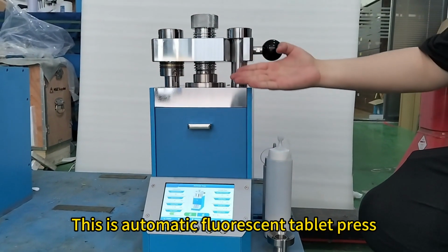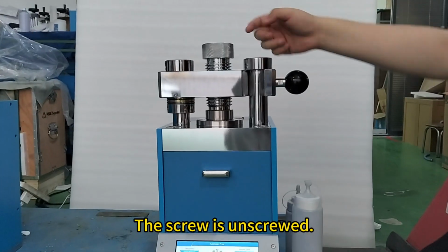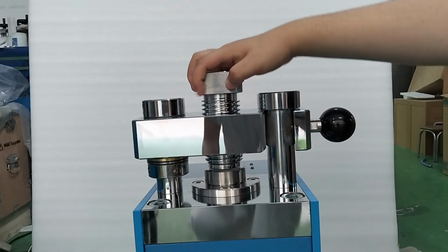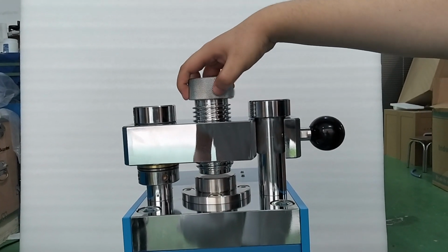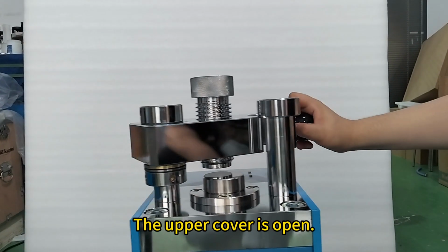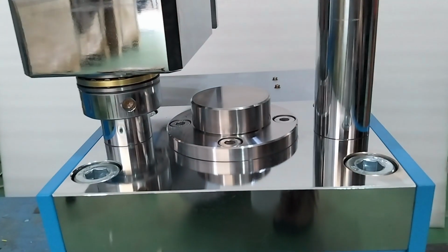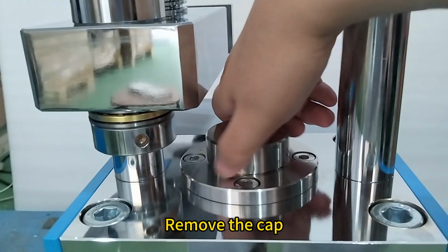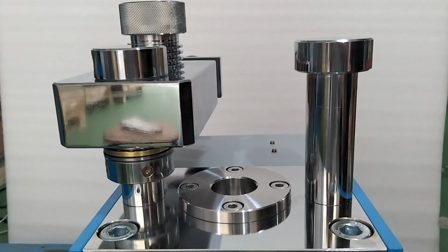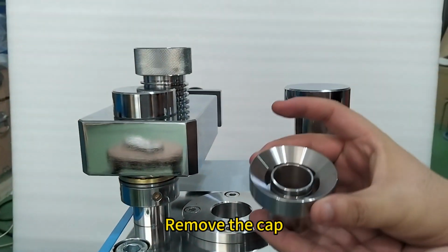This is an automatic fluorescent tablet press. The screw is unscrewed. The upper cover is open. Remove the cap. Remove the cap.